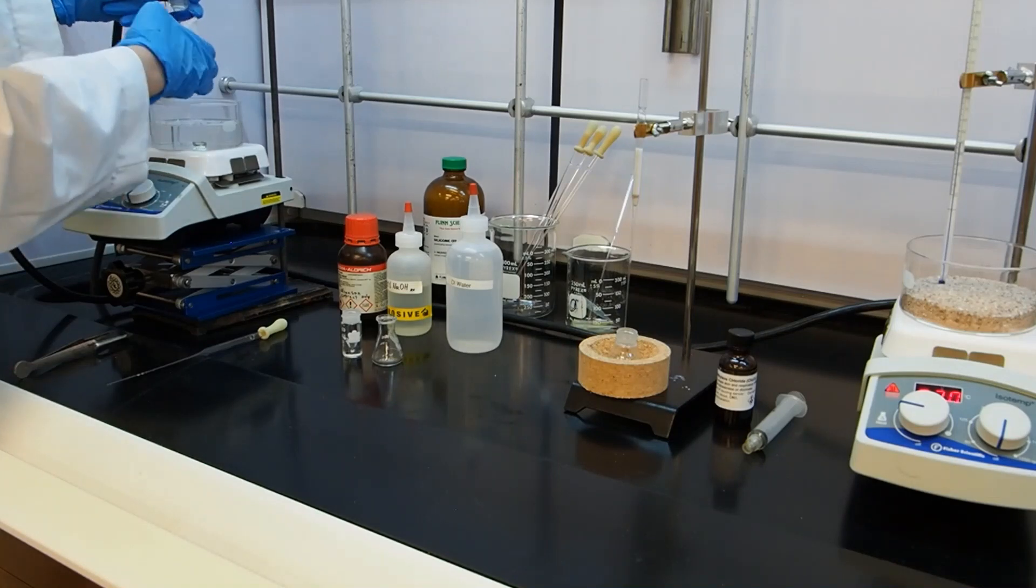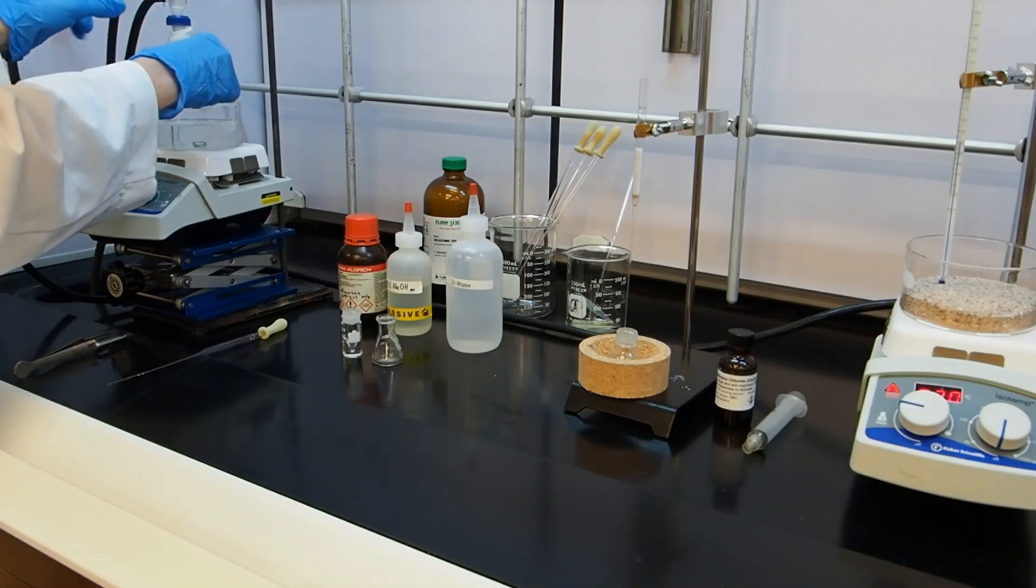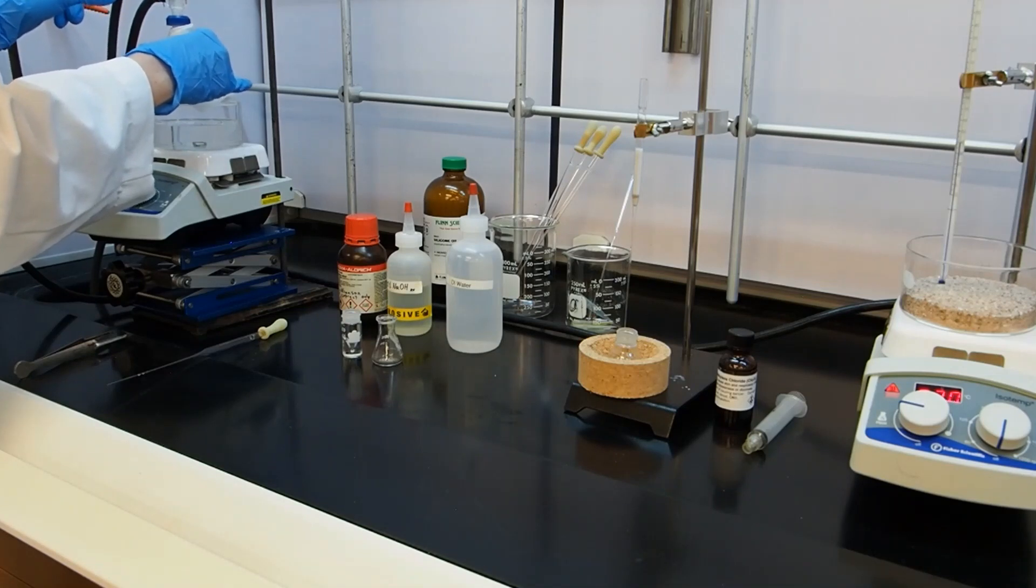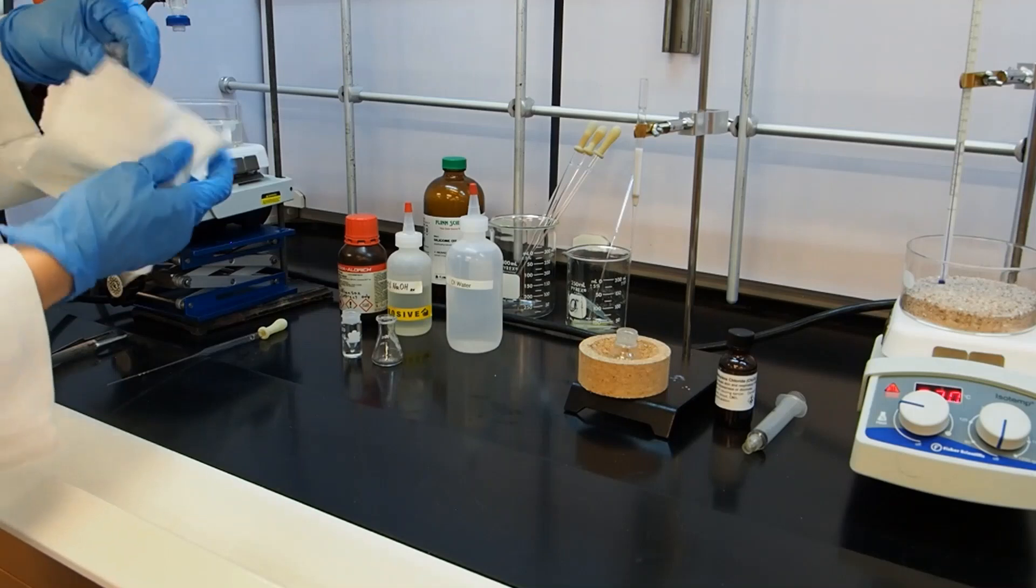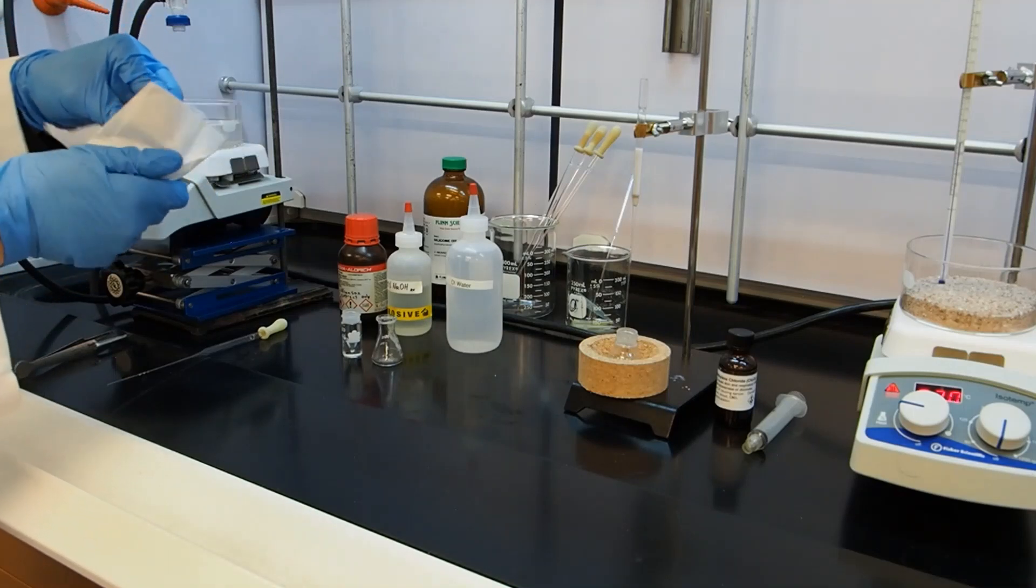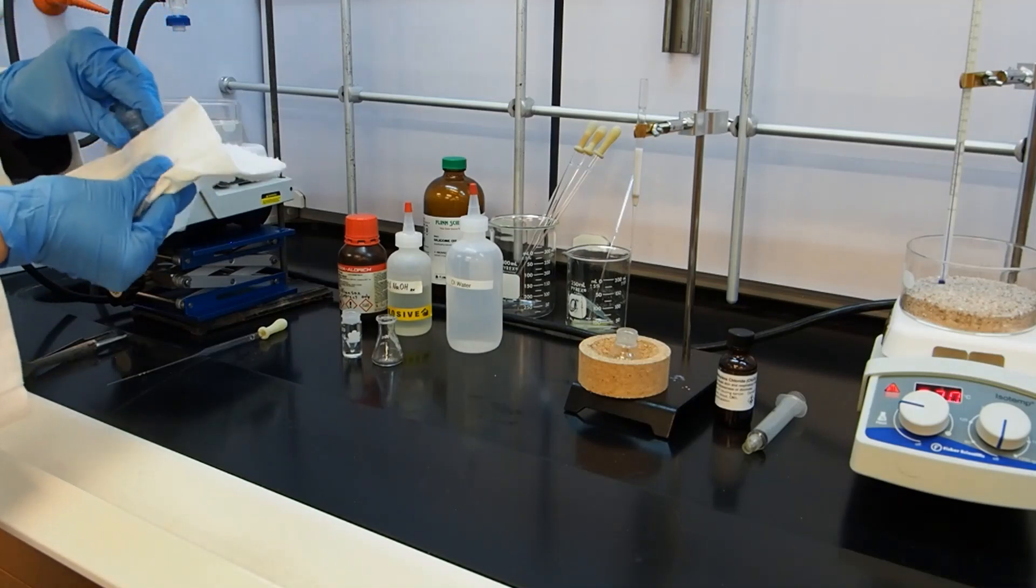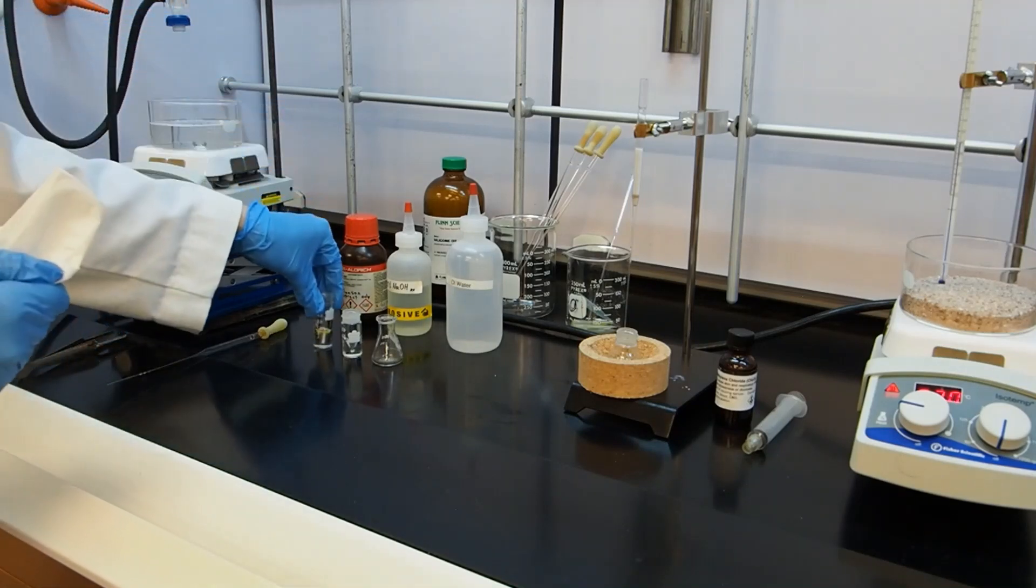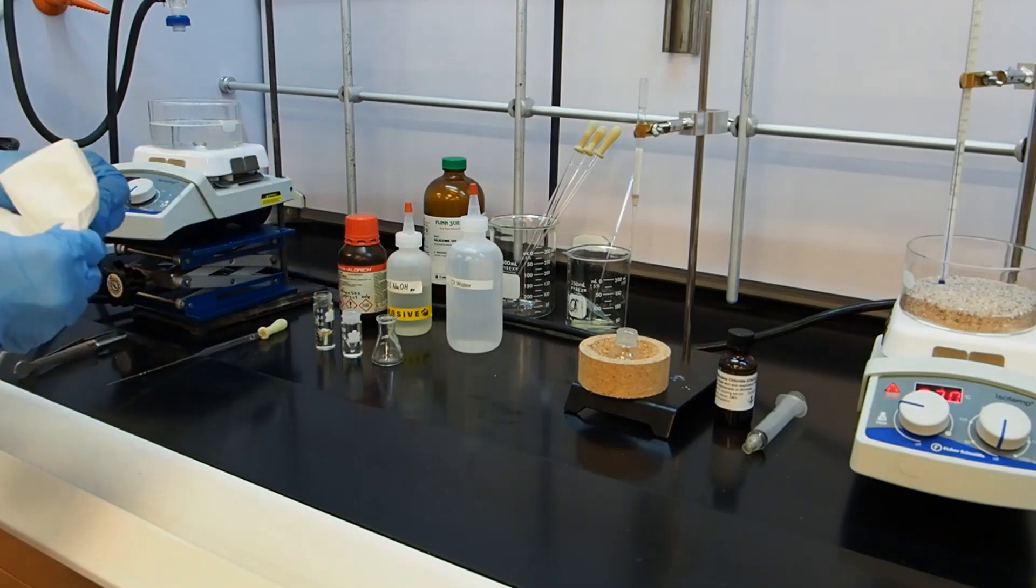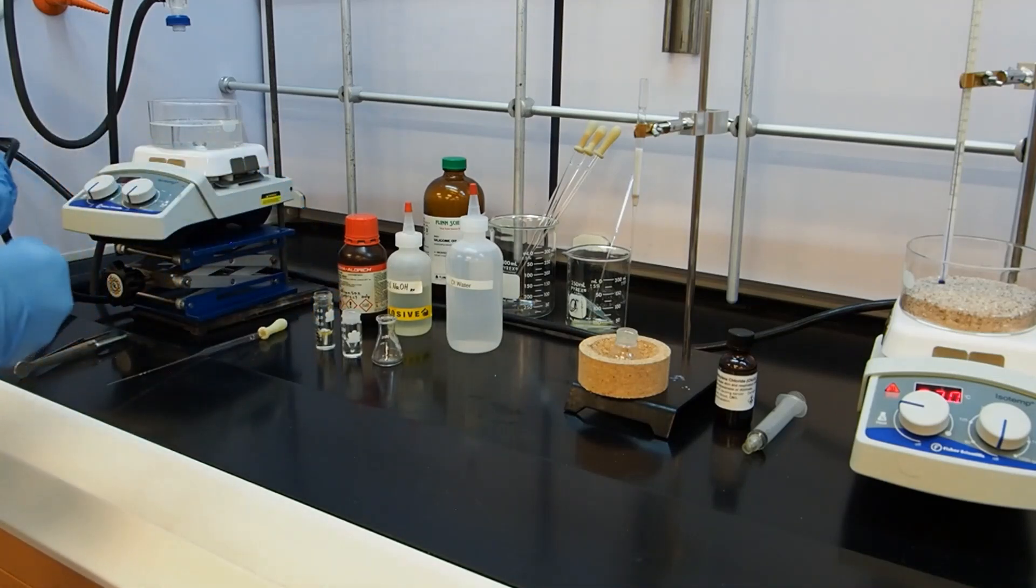It might be a little difficult to remove the vial from the condenser. Just give it a little twist. So we want to make sure we don't get oil all over the place. So we'll do a good job wiping it off. So there's my reaction mixture. I'm going to set the paper towel aside.